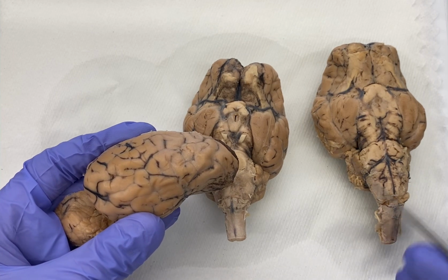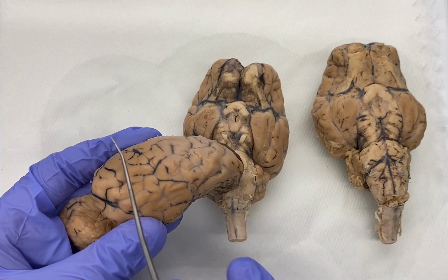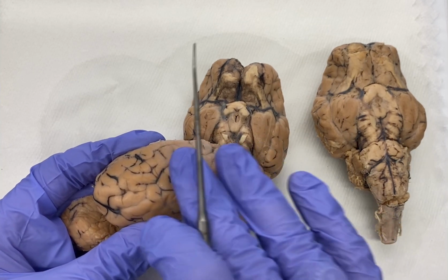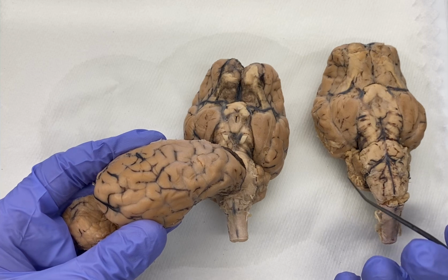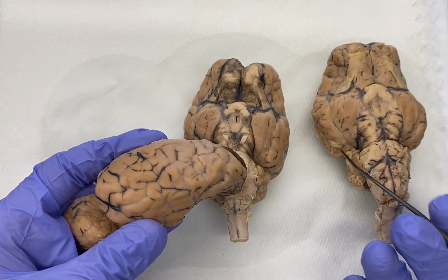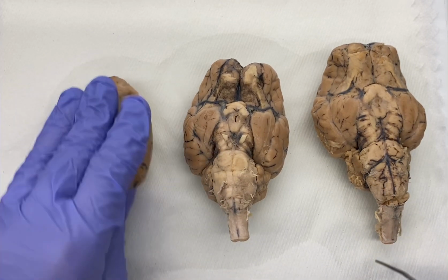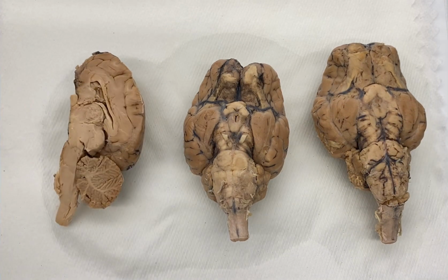And these layers that we're talking about would also exist around the spinal cord as well, right? So that's the deepest layer, the innermost, attached to the brain: the pia. Just superficial to that, you'd have the arachnoid mater. And then superficial to that, the outermost, you would have the dura mater. The dura is the toughest. You can actually cut it and remove it, and that is what has been done on these brains here, so they're not present.